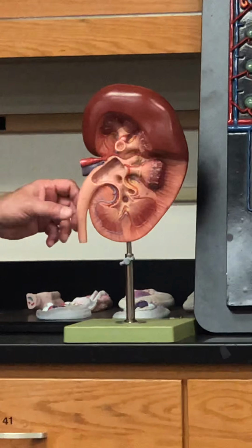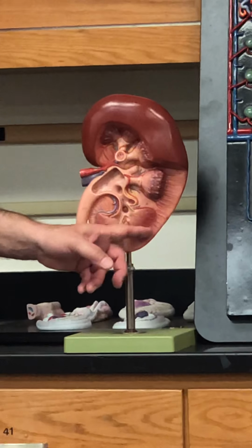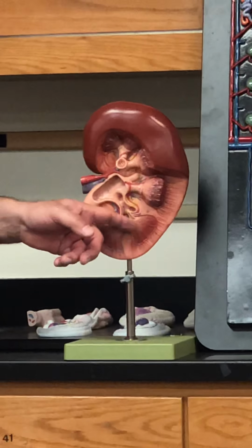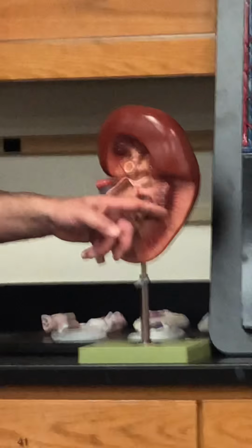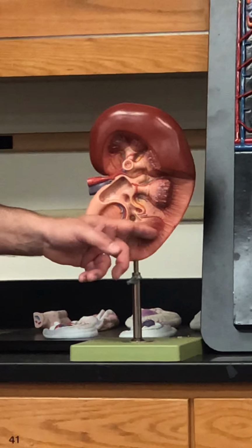Medulla. Okay. Those that we have vessels. We have one vessel here that seems to arch around this structure. What's this structure, first of all? Pyramids, right? So we have about 7 or 8 pyramids. You can see this is nice because it shows you a three-dimensional look. It looks like a funnel. And it really is because it's filled with these striations. What are these striations?